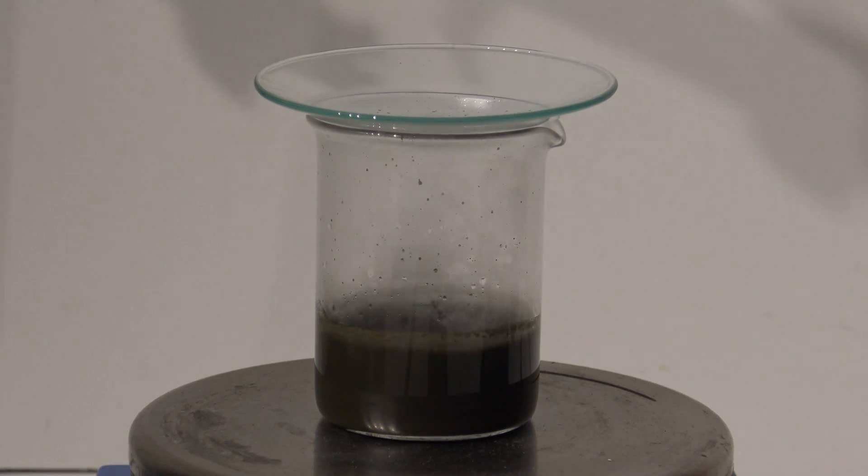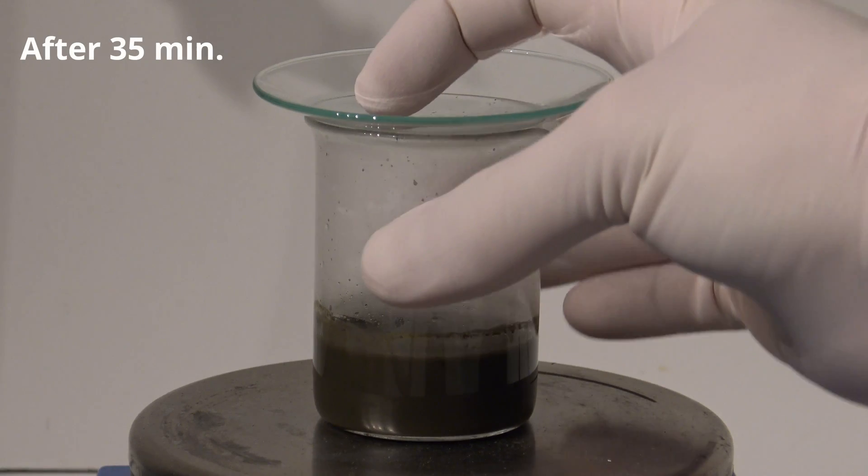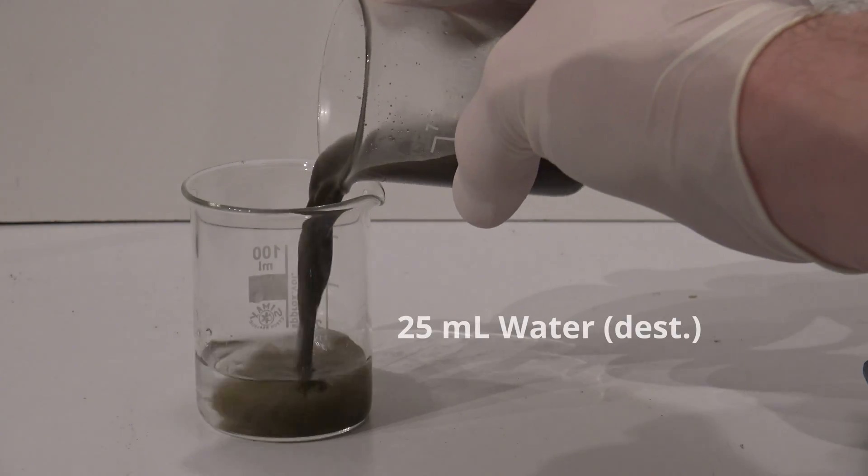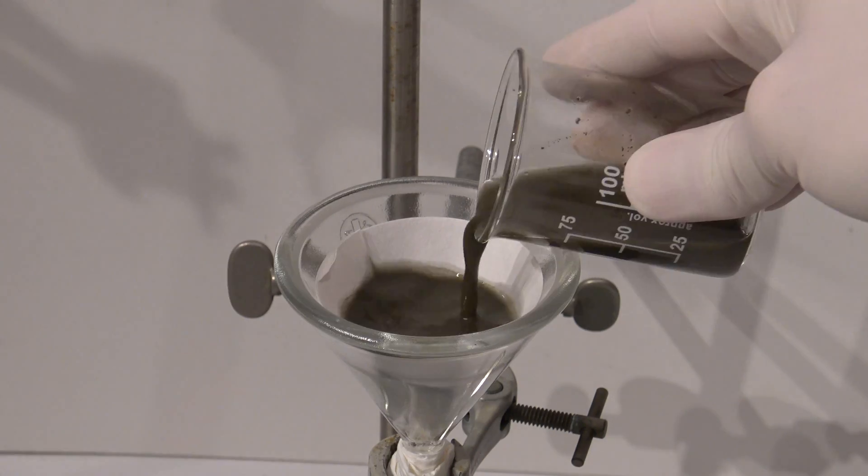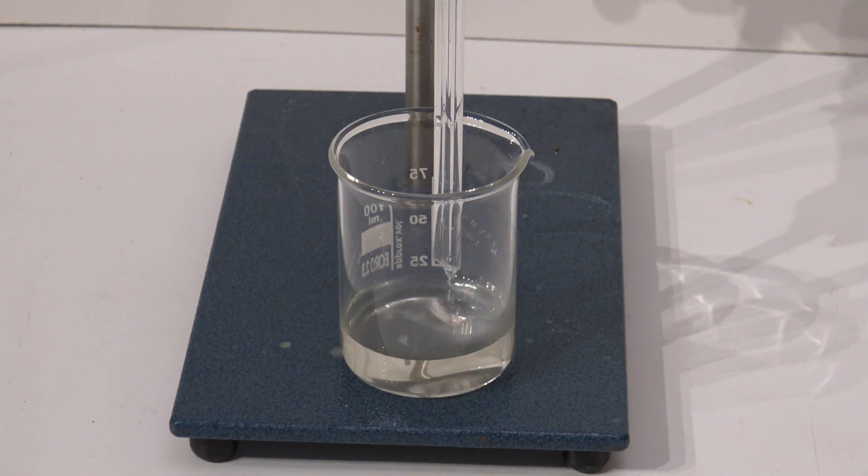Here the formation of the siloxene can be seen way easier in time lapse. After 35 minutes the mixture was added to the same amount of distilled water. The properties of this siloxene are the same in the shown experiments.